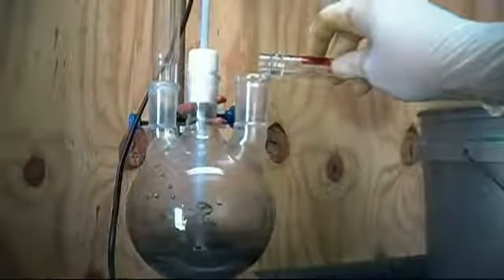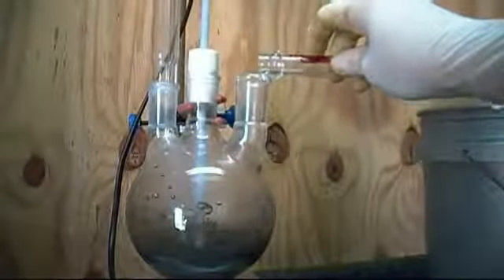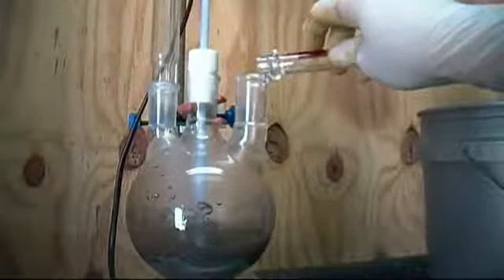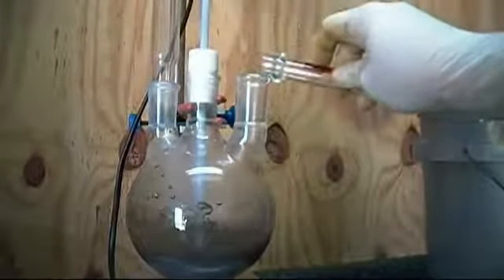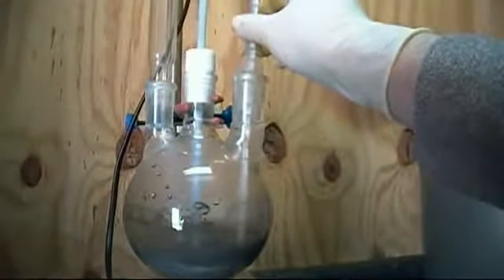Now start the mixer and pull out the thermometer. Slowly add the hydrochloric acid. We need a way for pressure to escape this apparatus since we'll be heating it. So when you replace the thermometer, replace it very loosely so that any trapped gases or buildup of pressure can escape.